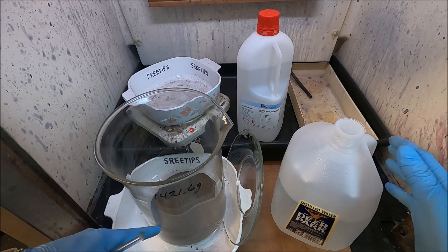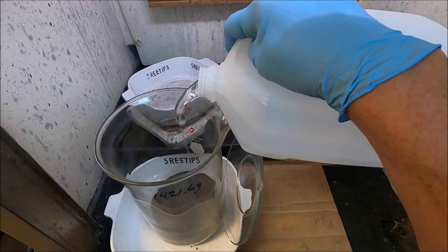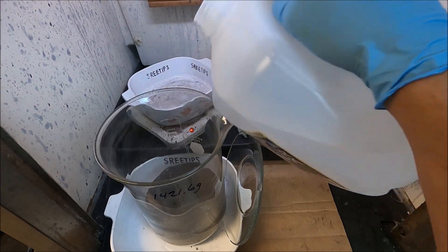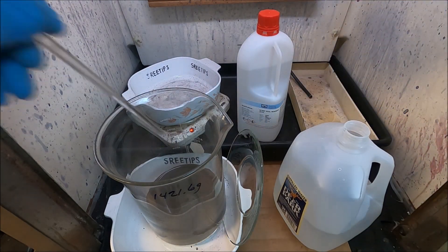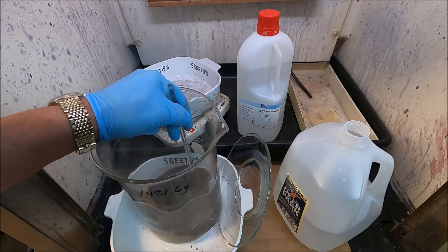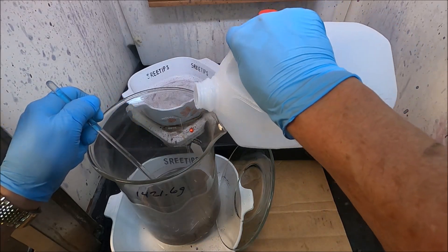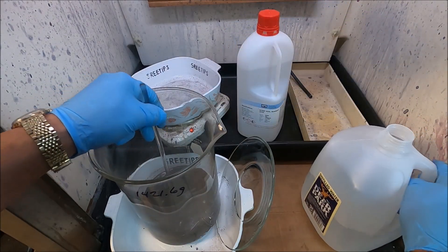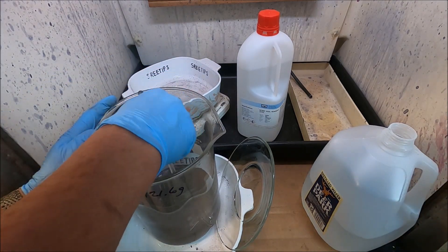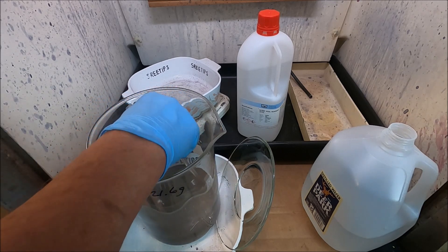I'm going to add some distilled water to our finely divided burnt filters here, make a slurry out of this, fill it up to about the 1,000 milliliter level. Add a little bit more here. All right, I got everything wet now.